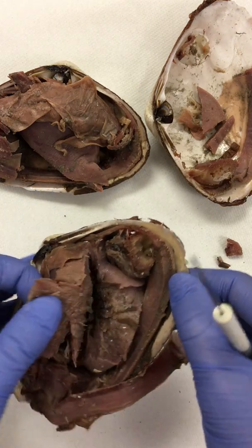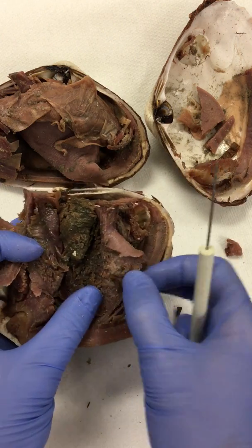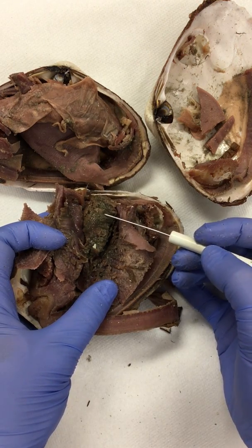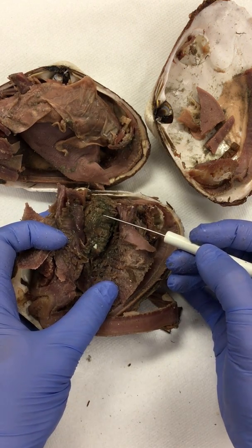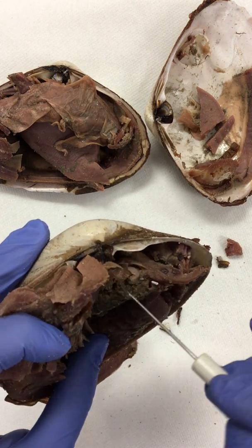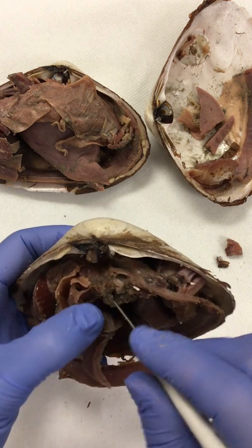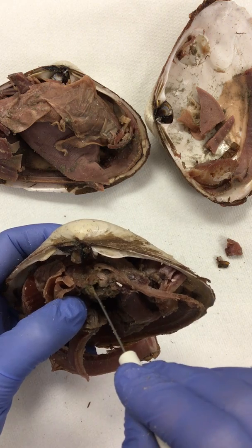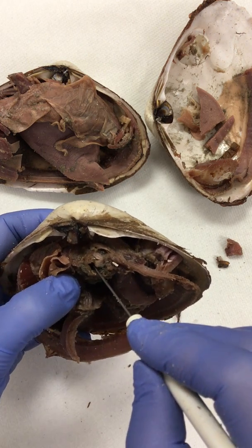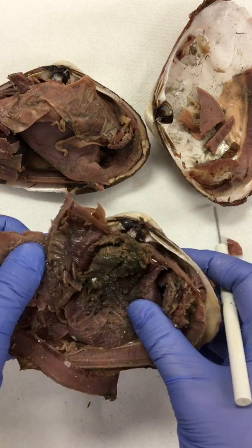All right, you're going to bisect it, and as you've bisected it, you open it up and you see all these really interesting looking things inside. Inside you've got this large green structure, and the large green structure is the liver, also known as the digestive gland. At the anterior region of this will be where the stomach and the mouth are. So up here in the front you can see that entrance or that hole. You might not clearly be able to see this on yours simply because you've bisected it and cut it in half, and if it's a hole it's just going to be an opening.